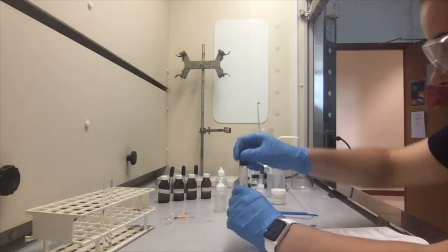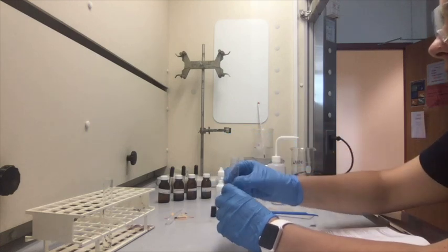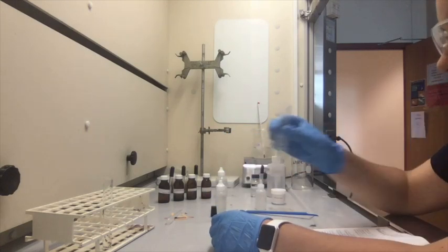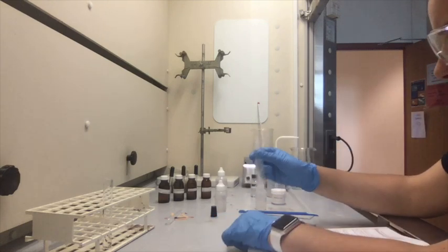Is there any odor? Let's check. Yeah, there's still an odor. I think it's even sweeter now.